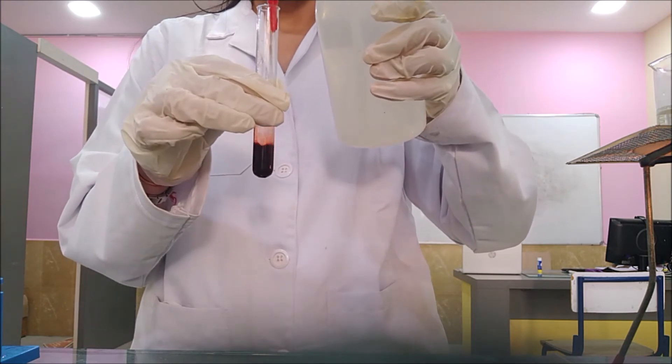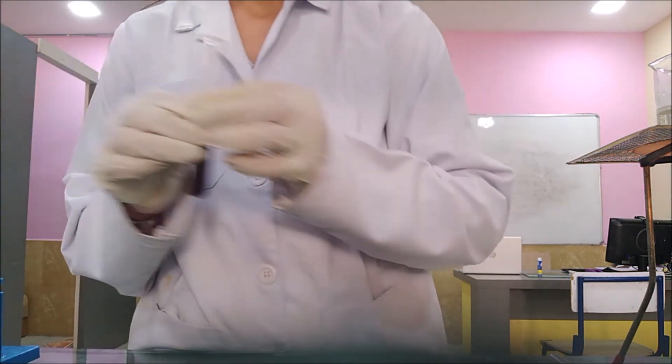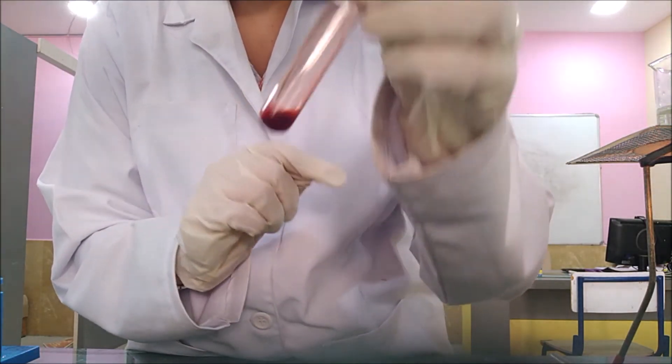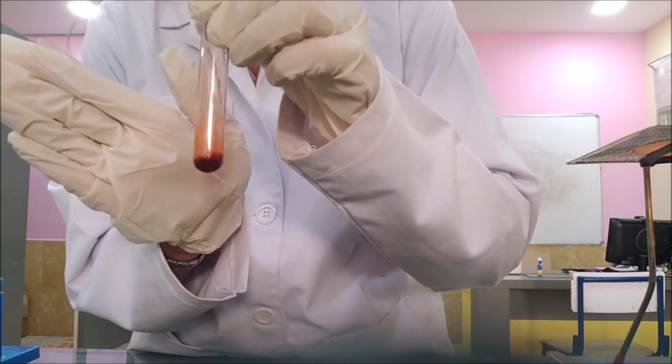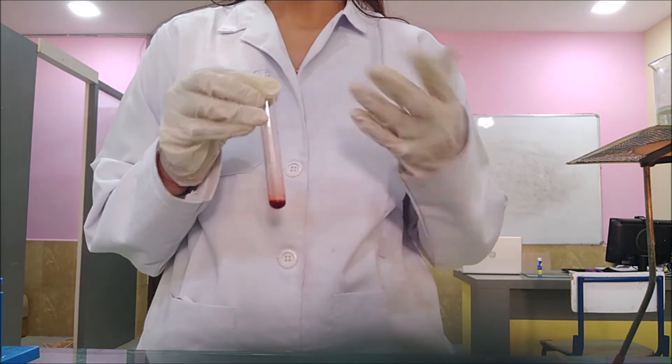I am going to dilute this solution in order to see the clear observation. Now you can easily see the red coloration. It shows the presence of Ketonic Group.